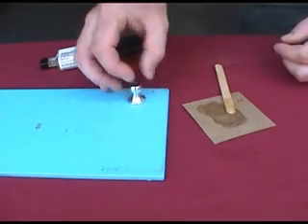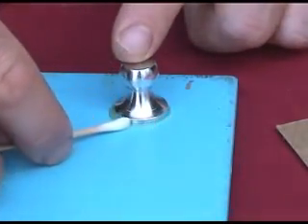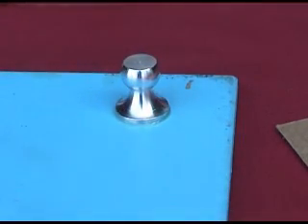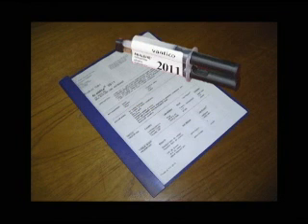Twisting, rocking, or sliding of the dolly may generate undesired air bubbles. Excess epoxy should be wiped away from around the dolly without disturbing its position. Dollies to be placed on uneven, vertical, or overhead surfaces should be held in place with removable tape until fully cured. To prevent adhesive failures, it is important to allow the adhesive to cure per manufacturer's instructions. In some instances, the addition of heat may promote stronger and faster bonding.